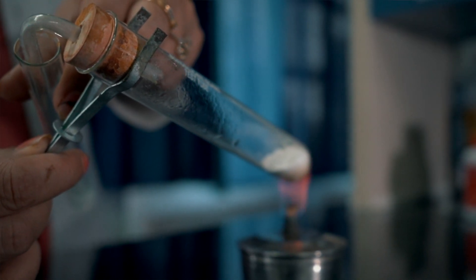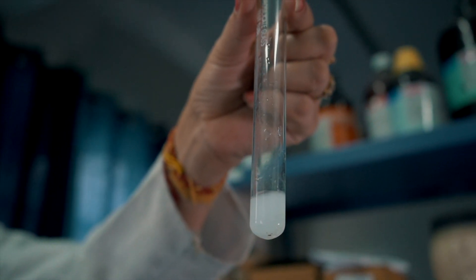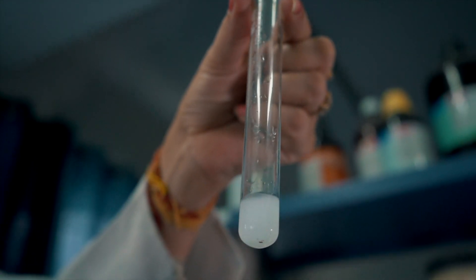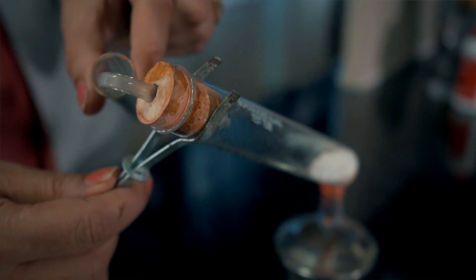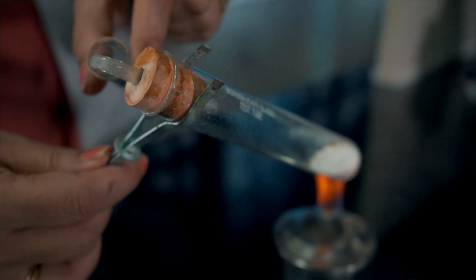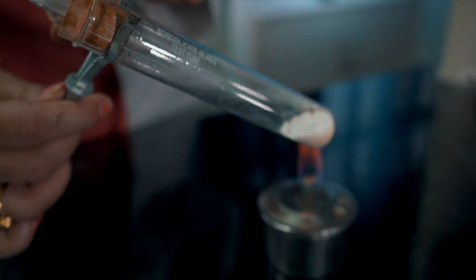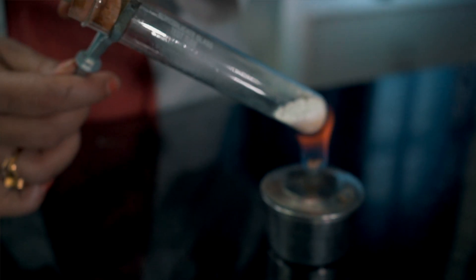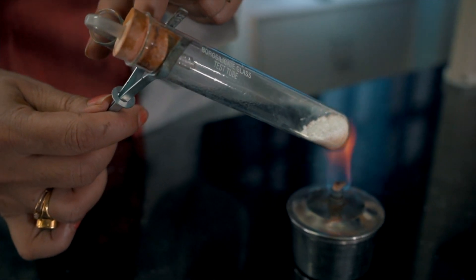Now you can see lime water turns milky due to the formation of insoluble calcium carbonate. On prolonged passing of carbon dioxide gas through the lime water, the milkiness disappears due to the formation of soluble calcium bicarbonate produced during the reaction.